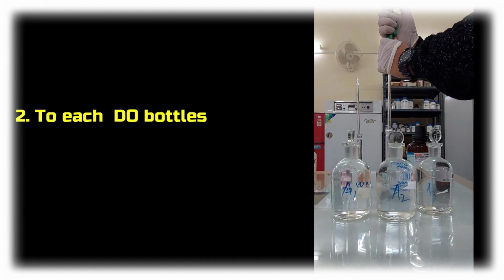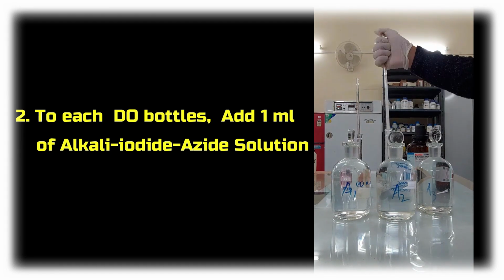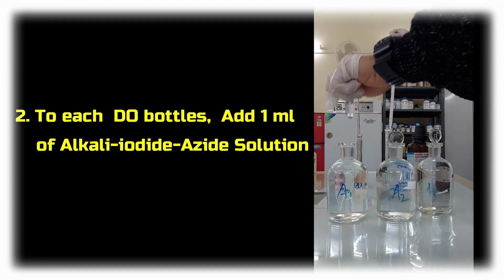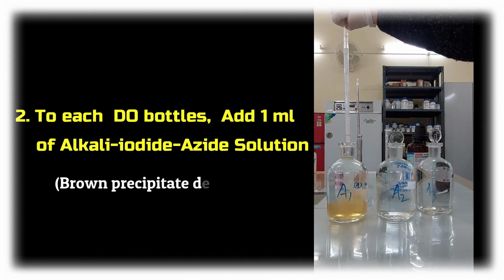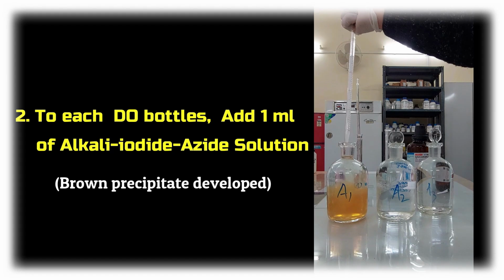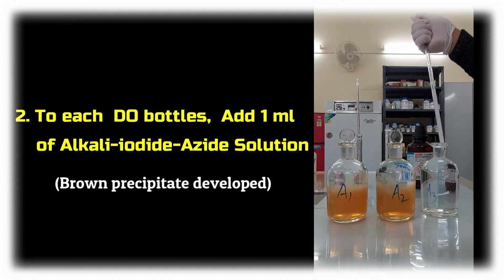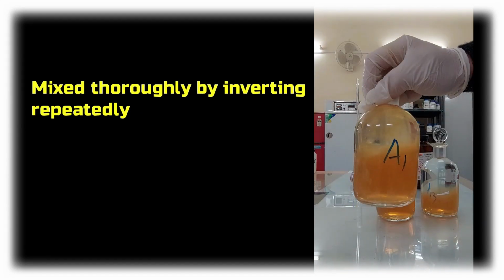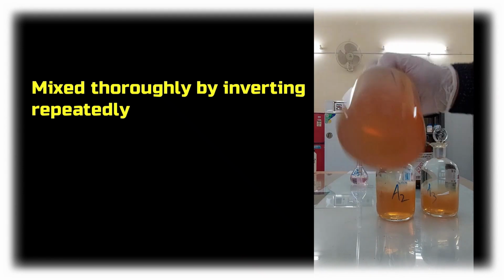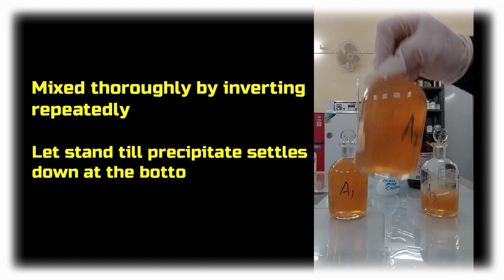And next, to each DO bottle, add 1 ml of alkali iodide azide solution. And on addition of this solution, a brown precipitate will develop. Mix the solution by inverting repeatedly and let the precipitate that is formed settle down at the bottom.